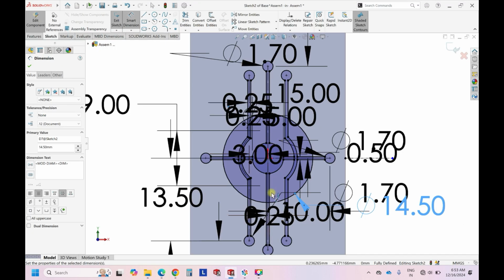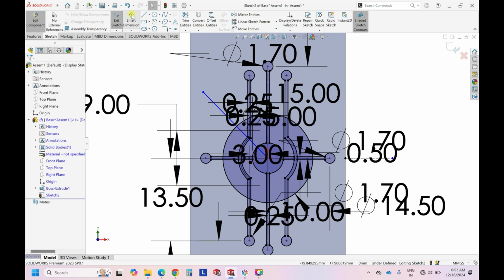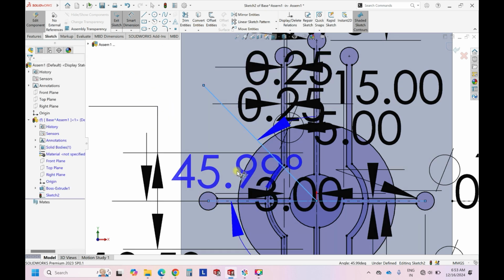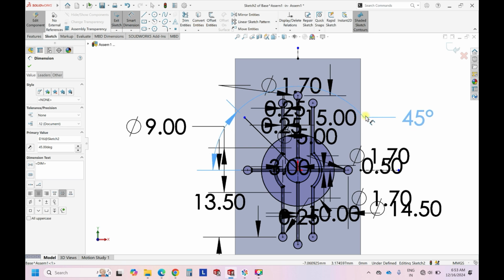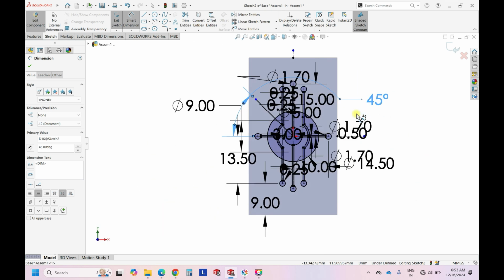So for that, what we do, okay, so we can have a curve. Okay, so now we can have a line from here till here. Okay, and what we can do, we can have the dimension of this line and this center line. So this we can maintain as 45 degrees. Understanding? So this is 45 degrees now. Okay, so if you see, this is what I'm telling. This is a straight line and it's a 45-degree curve. Right.